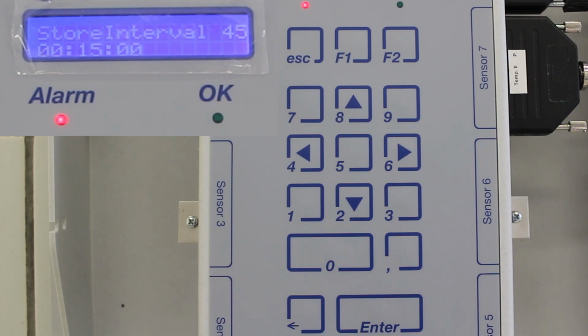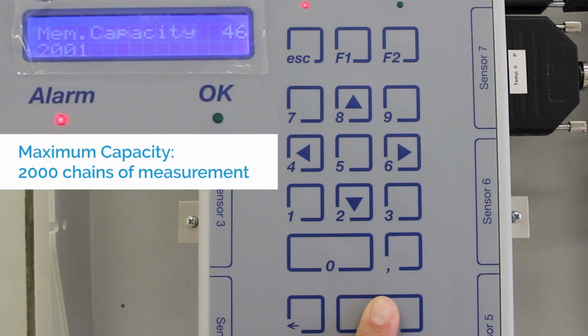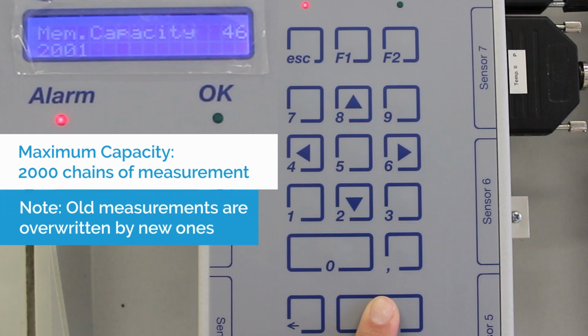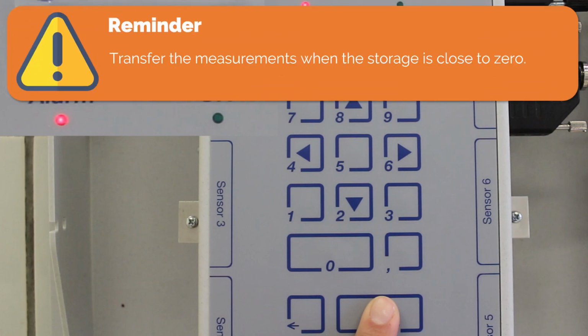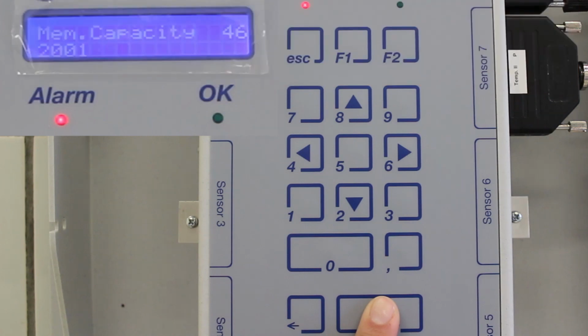The next menu labeled Mem Capacity will show the space available. The IKS Aquastar can store up to 2,000 chains of measurements. If this limit is exceeded, old measurements will be overwritten by the new ones. Reminder: transfer the measurements when the storage is close to 0. Then, press Enter. The Erase memory wipes out all the measurements in the Aquastar.